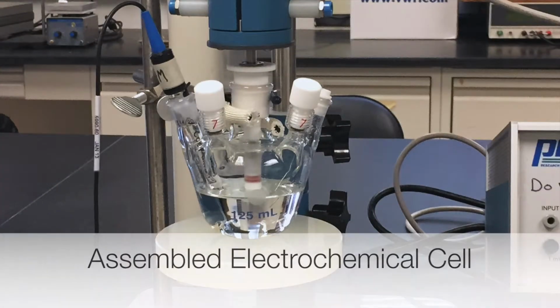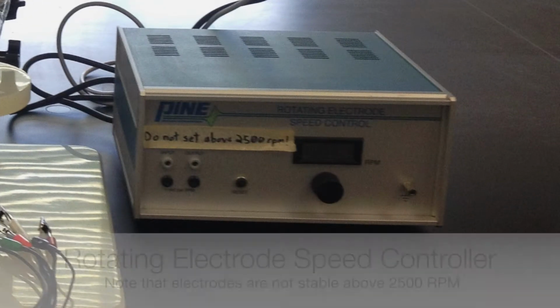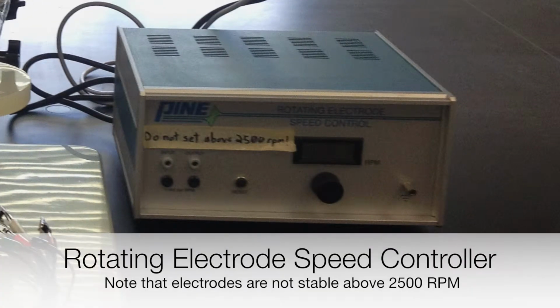A glass electrochemical cell with a rotating shaft for the working electrode. A speed controller for the rotating shaft. Remember that under no circumstances should the controller be set to a speed above 2500 RPM.